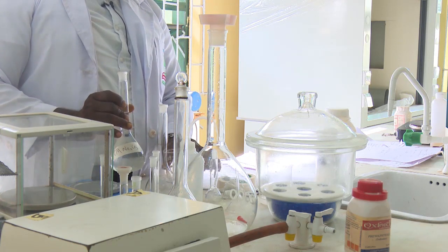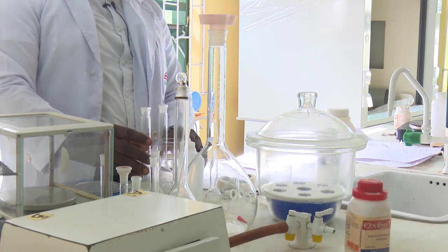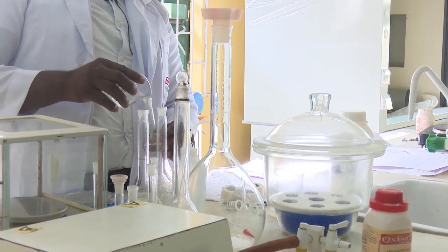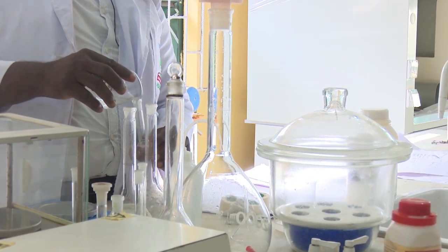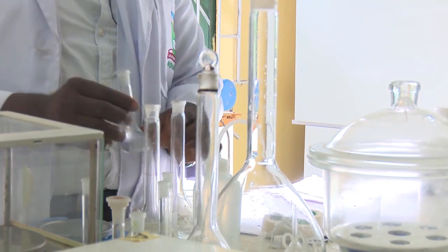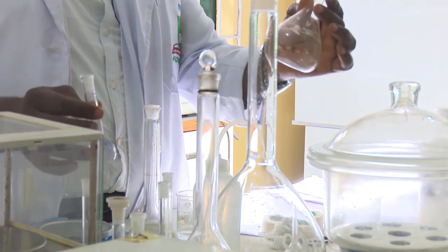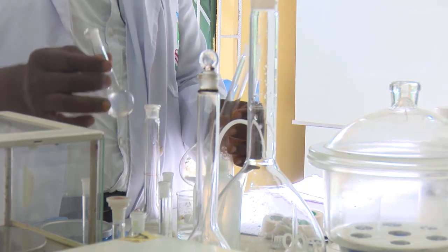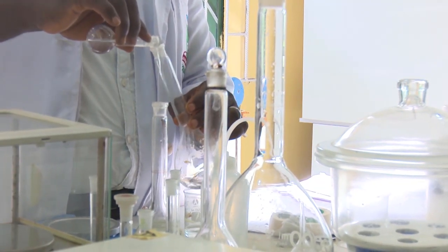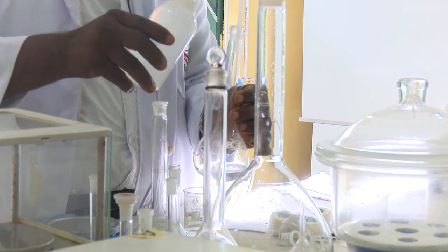Now, you can see this is your 1 molar sodium carbonate. I am taking a little out of it. From what we have calculated, we say 25, so I'm going to take the 25 here. This standard volumetric flask is 25 mil. Now this is my 25 mil of 1 molar sodium carbonate. And this is my 250 mil, because this is the volume I want to prepare my 0.1 molar into. So the next thing I do is to pour this 25 mil of my original solution into this, and make it up to the mark.